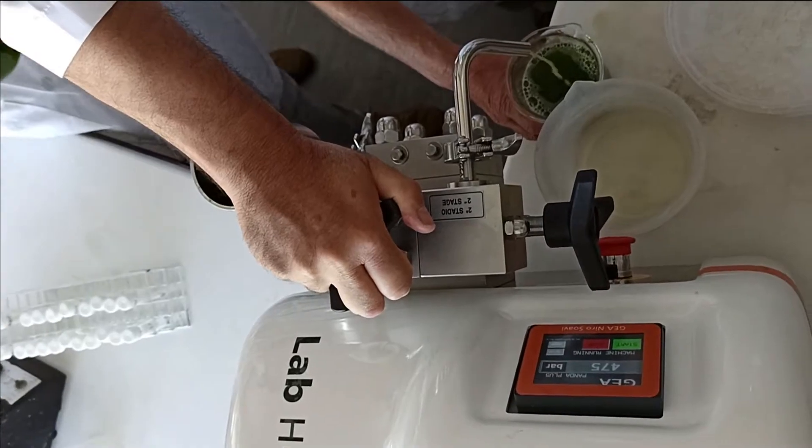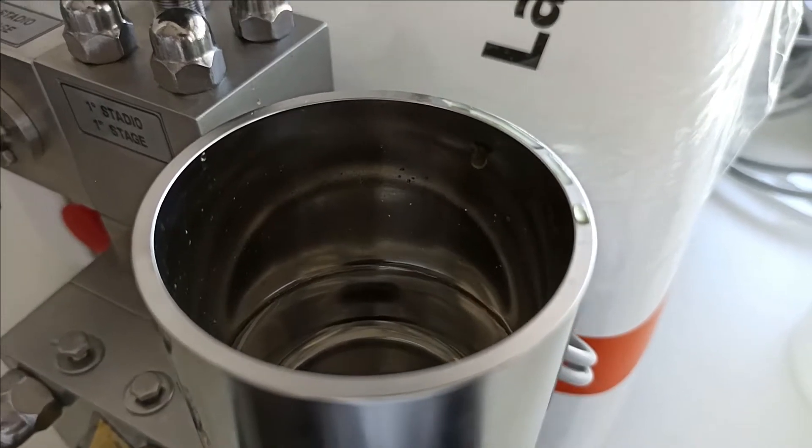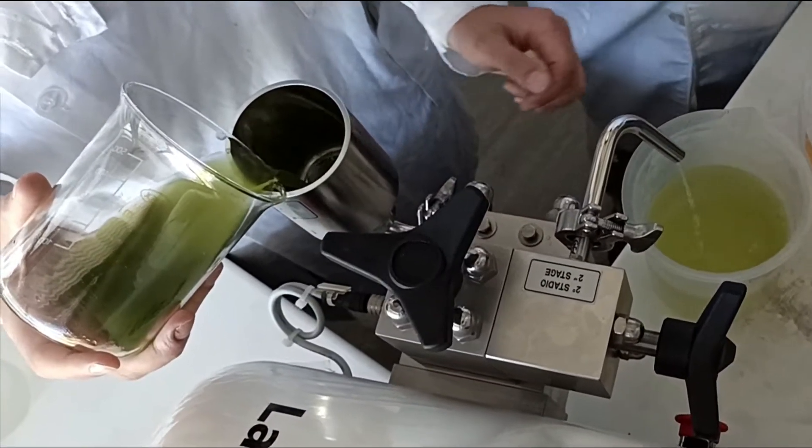As the machine is initiated and pressure applied, the holder must always have water or culture. To avoid mistakes, keep one person responsible for it.